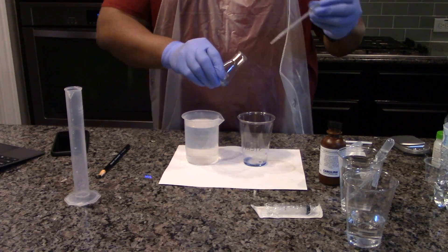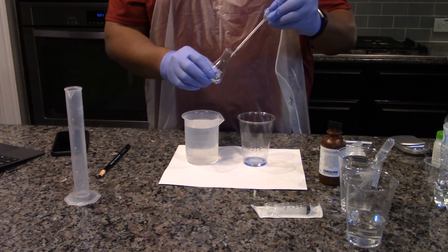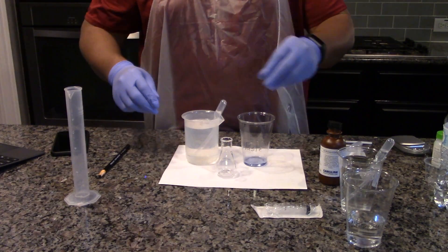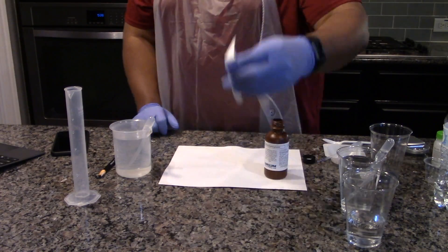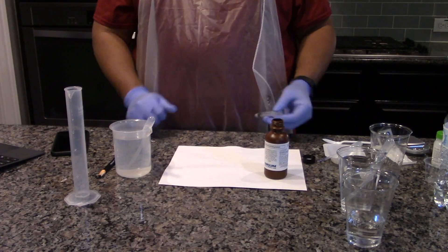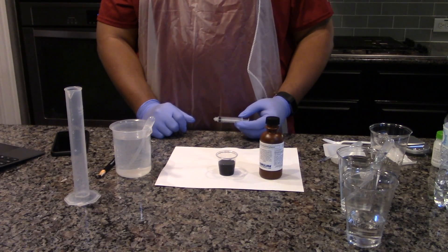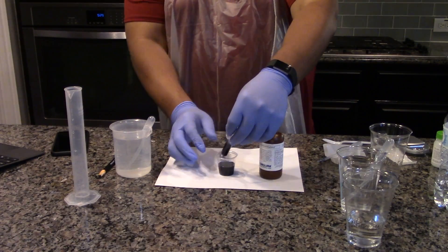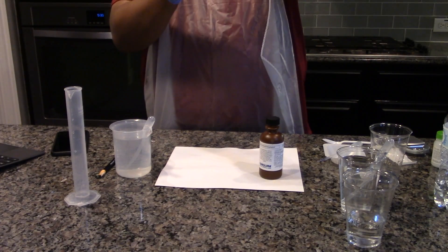Empty the rinse water into the waste cup. Fill the plastic medicine cup approximately half full with DCPIP solution. Fill the syringe with the DCPIP solution to the 5 milliliter mark. If there are any air bubbles in the syringe or in the tip, empty the solution back into the cup until the air bubbles are gone.